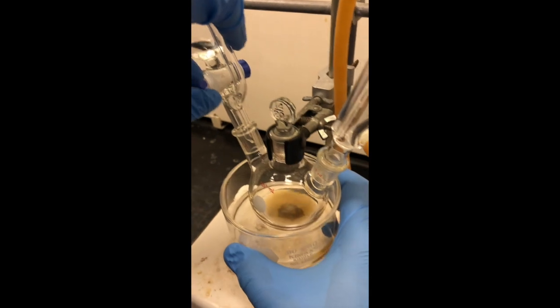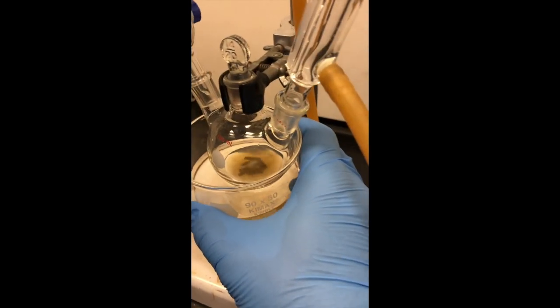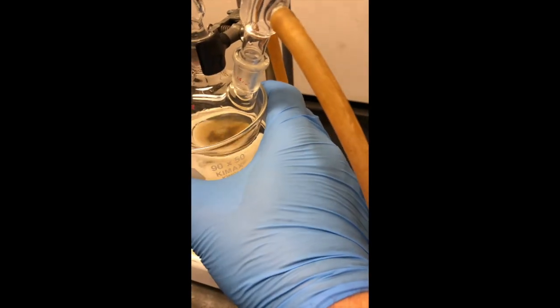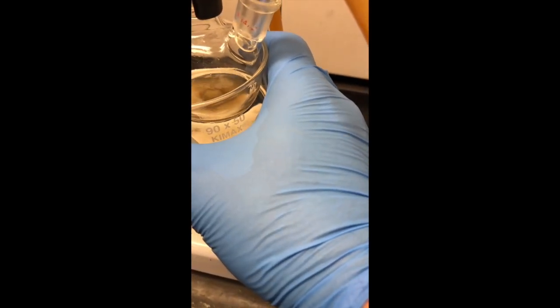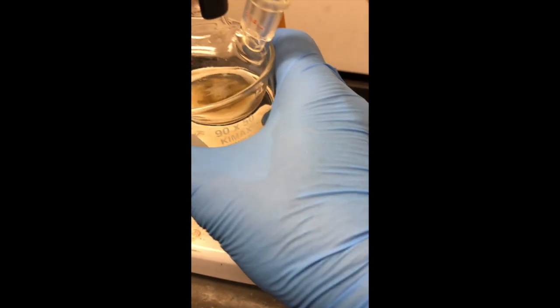Now we're ready to go ahead and add the remainder of the bromobenzene. We usually start the reaction with the smallest amount of bromobenzene first just to get it going. And then you add a little more as it goes along.